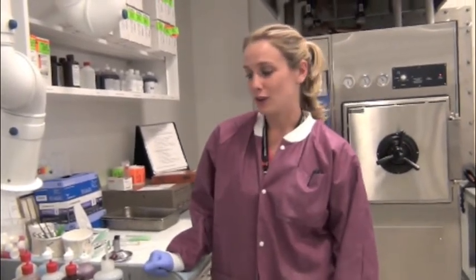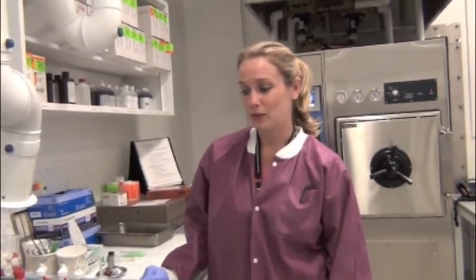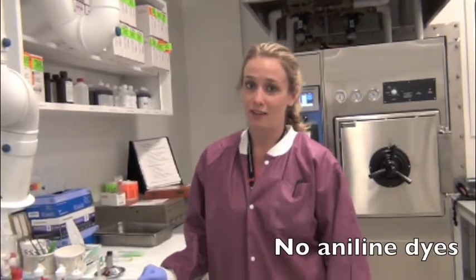Today we're going to talk about mycobacterial staining. Mycobacteria have high mycolic acids, which gives them a high lipid content. So in order to stain them, you have to increase your staining time and use special stains that do not have aniline bases in them.